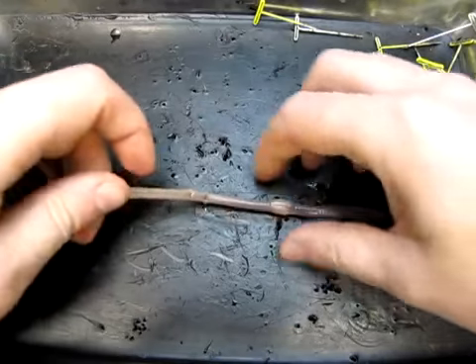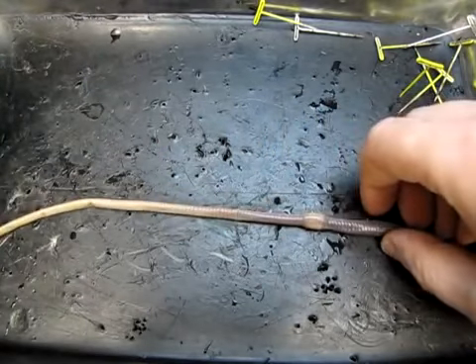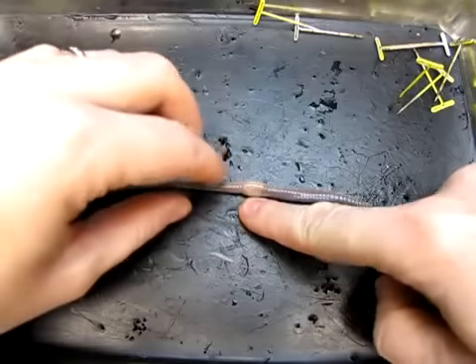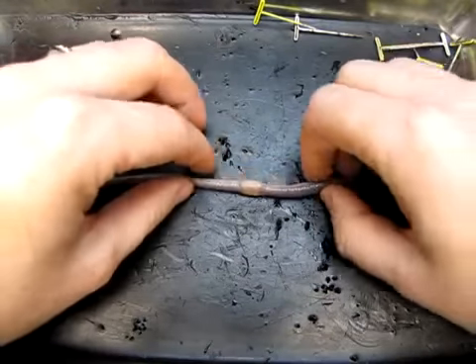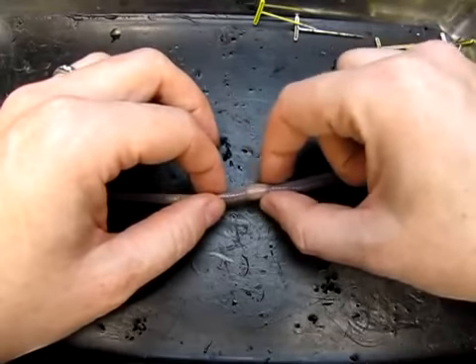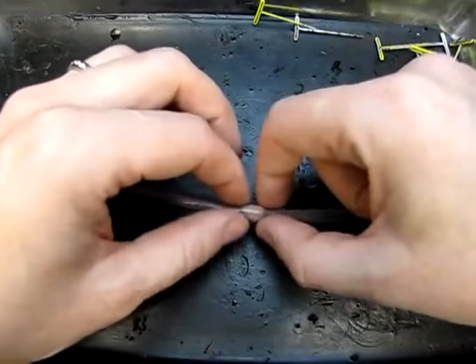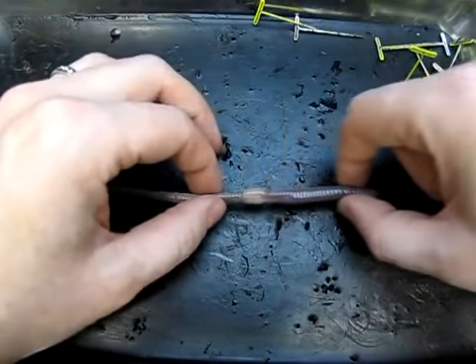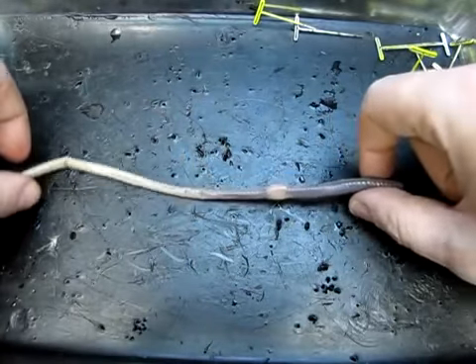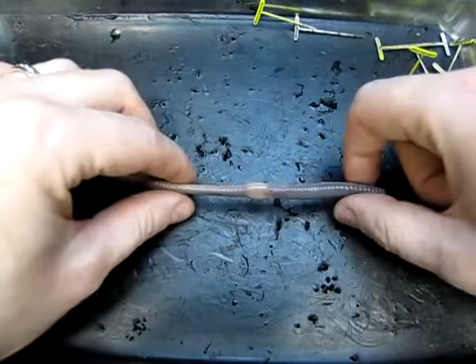And probably the most remarkable thing that you'll see on the earthworm is this pale, raised, sort of smooth area close to the anterior end of the body. This is called the clitellum. So clitellum, that is probably a good reminder for what the name of the class is to which this animal belongs, which is the class Clitellata.